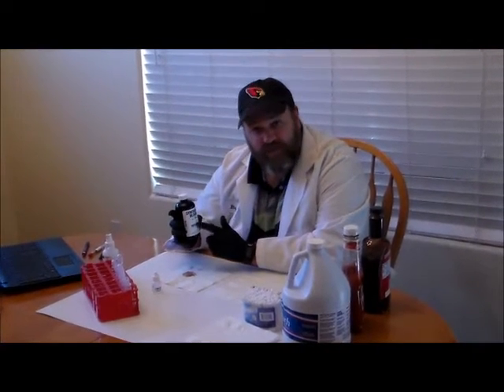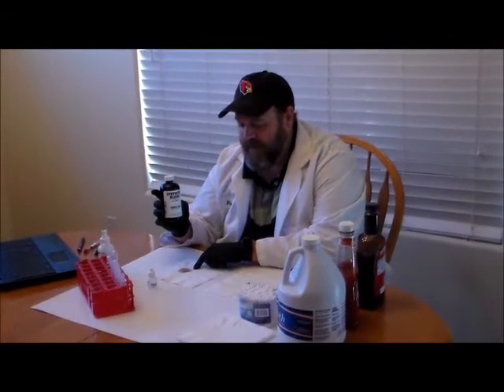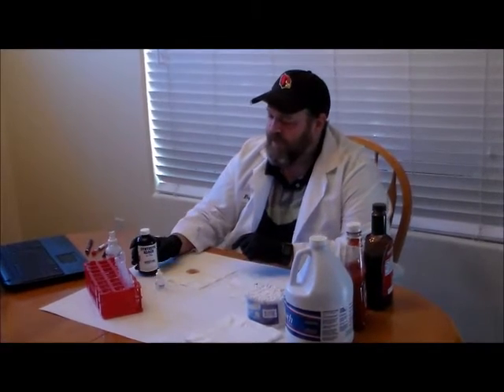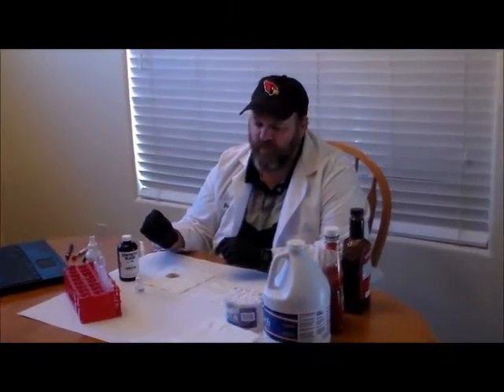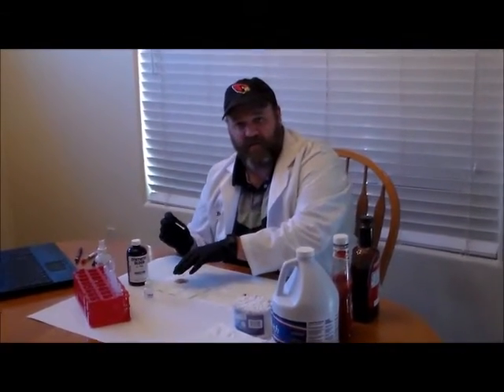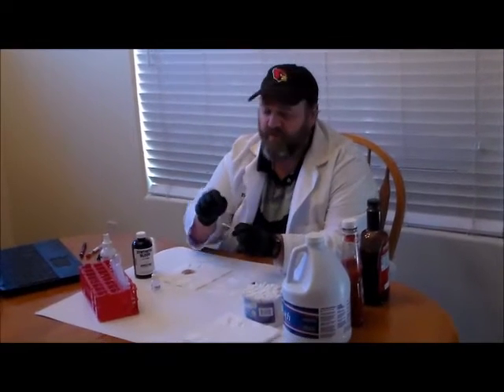You're not going to be testing blood, but you're going to be testing some synthetic blood. I put a small amount of this synthetic blood on this napkin so that we can actually test it using the leukomalachite reagent first. To test our stain, we don't want to add our chemicals directly to the stain. Instead, we want to collect a small amount of stain on our swab and then test the swab itself.